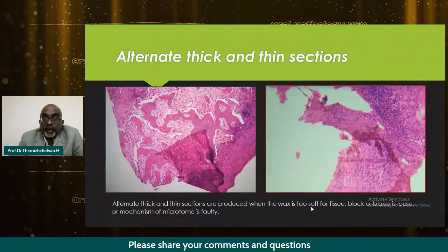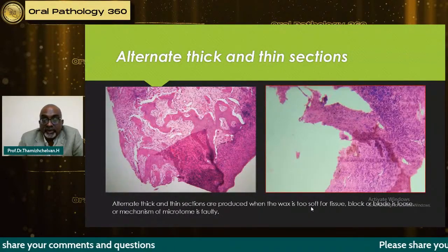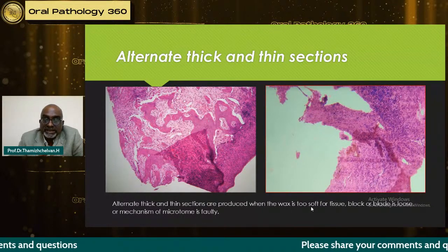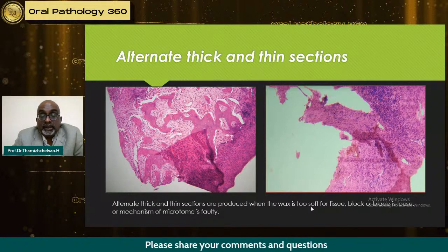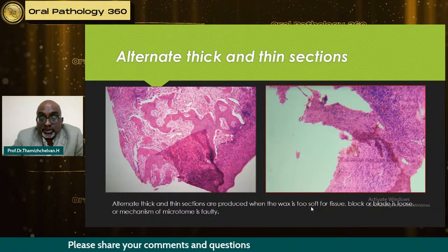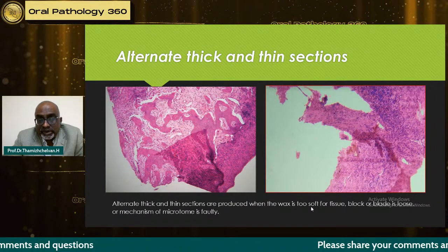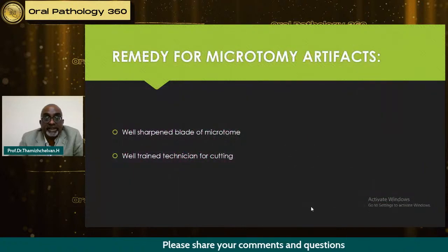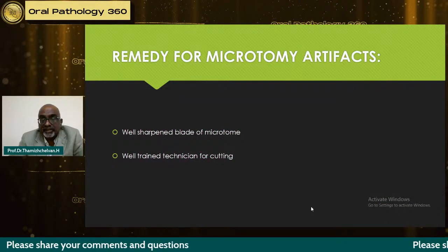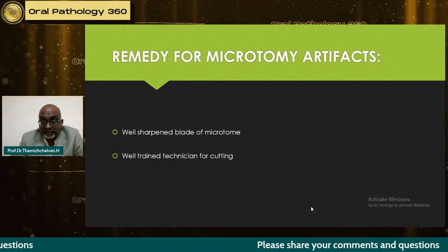And this is another problem here: either one part will be thick and one part will be thin. These are all initial stages of the technician, and this can be avoided once they're properly trained. And this is because the wax is too soft for the tissue, or the mechanism of the microtome is faulty. So the positioning is very important. All we need is a well-sharpened blade of the microtome, and also a well-trained technician for cutting.